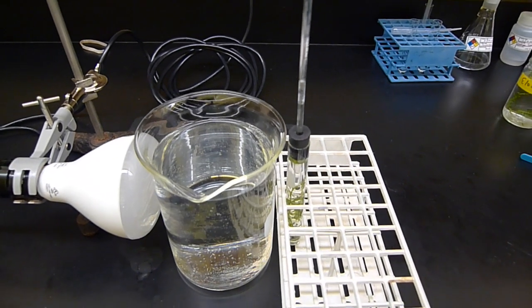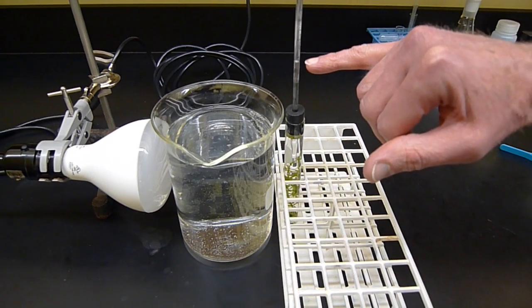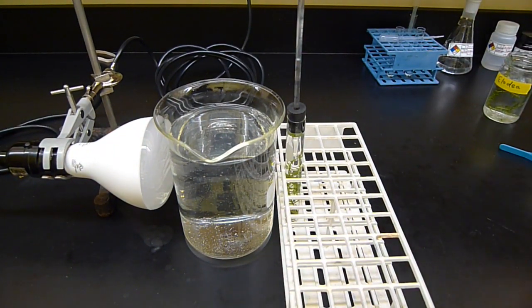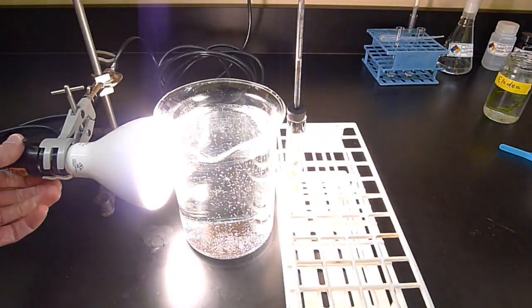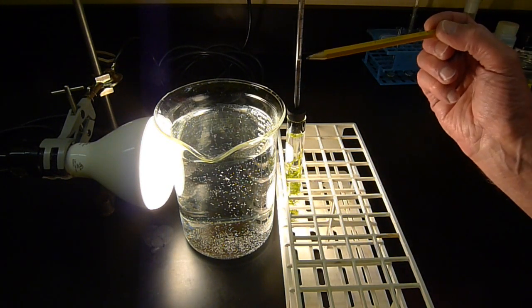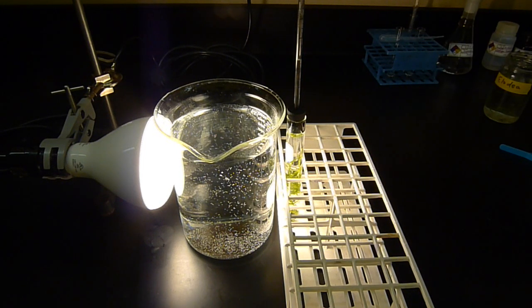So I'm going to turn on the light, and I'm going to wait until this starts to rise. It's a fairly bright light. This may be detrimental to the effect of the video. The camera might adjust. But I'm going to wait for this to start rising, and then I'm going to record positions here.